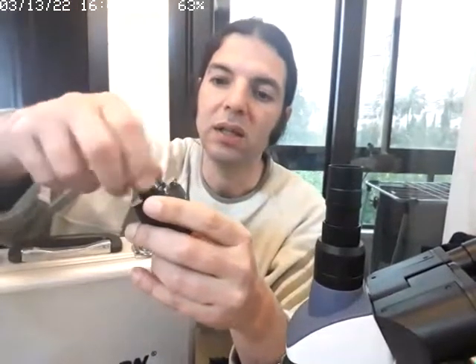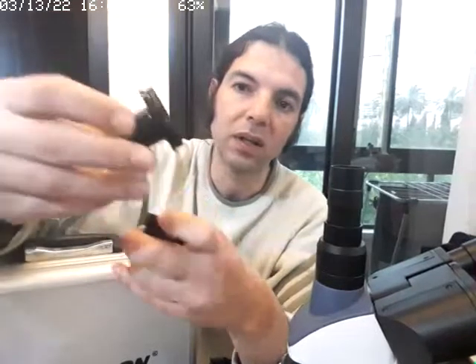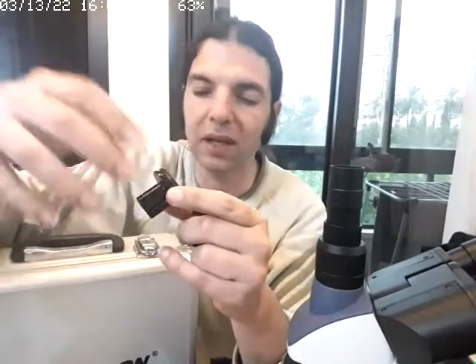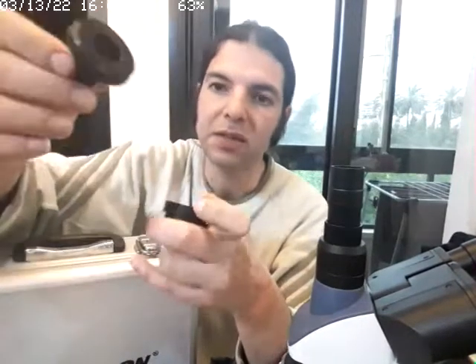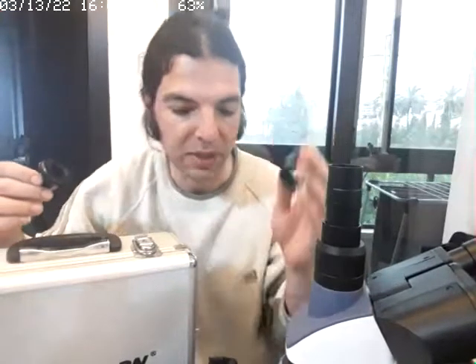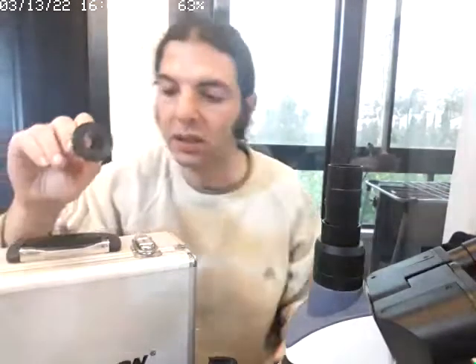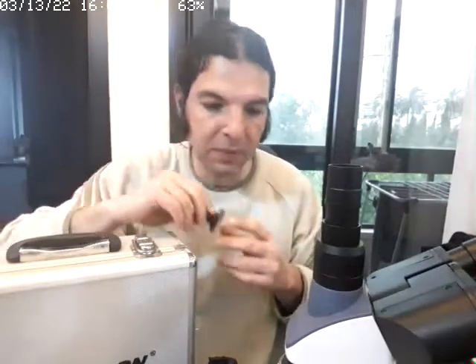So this is the T2 adapter. This is used with DSLR cameras, and you install here a ring made for your DSLR camera. I don't have one anyway, but I needed this because I wanted to use the 1.25 inch eyepieces, and my filter slider uses the 1.25 inch standard. So we're going to use this, remove this, and install the filter slider on it. But first we're going to show you how the filters dedicated for microscopes are installed.